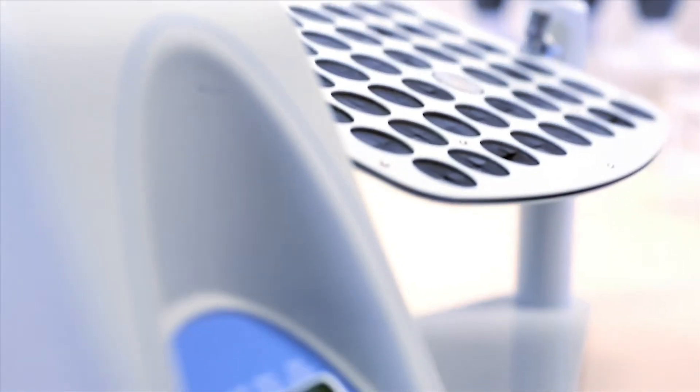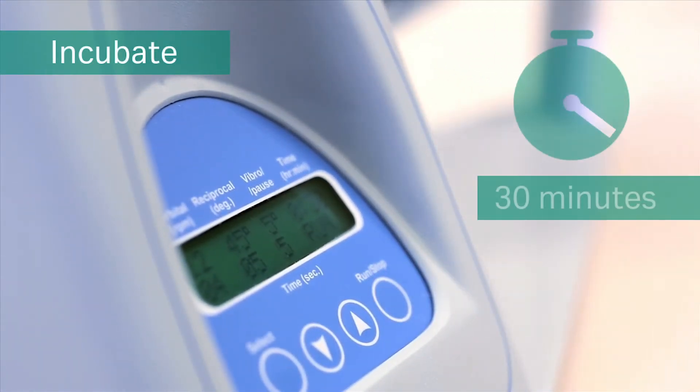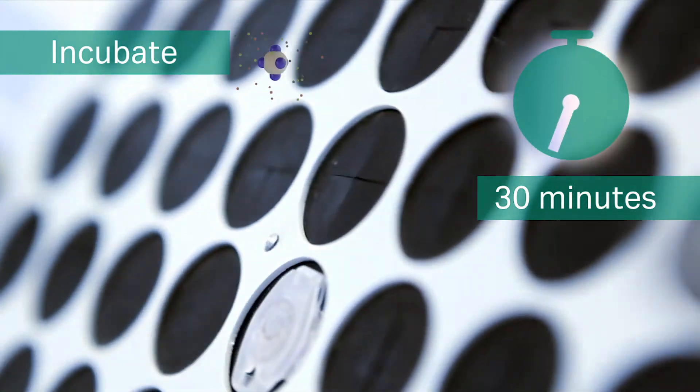Re-suspend the medium and incubate for 30 minutes with slow end-over-end mixing or by using a benchtop shaker.